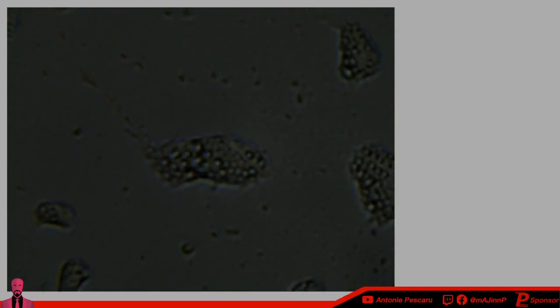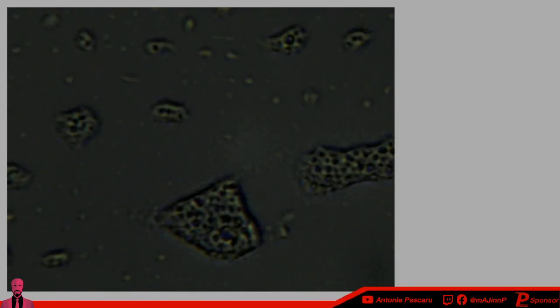Look at what I'm looking at here. This is supposed to be the nucleus, which is kind of screwed up. It doesn't have the actual nucleus shape. Correct me if I'm wrong. If anybody else is a better observer than I am and is a veteran at microscopy, let me know if that is an actual cell that I found, because I think that's the closest one that I could find.